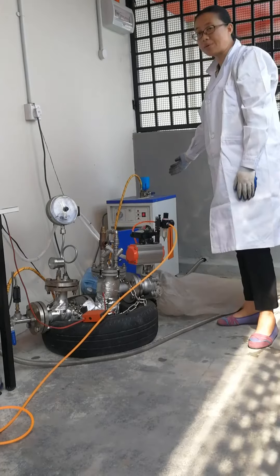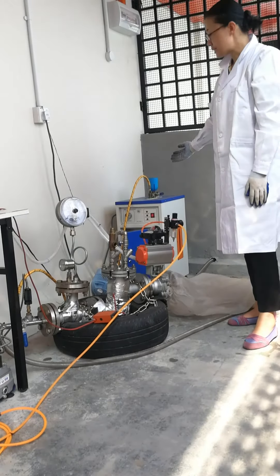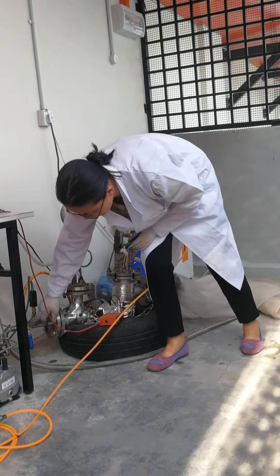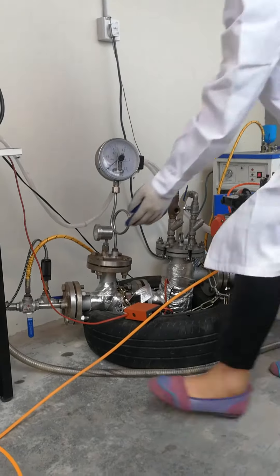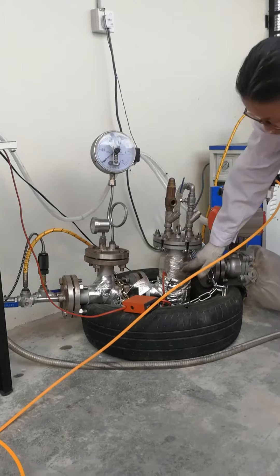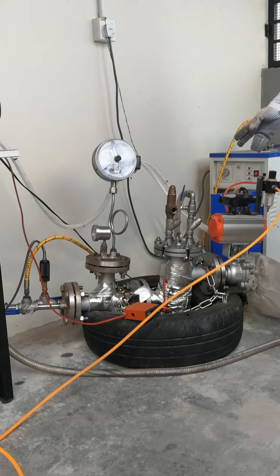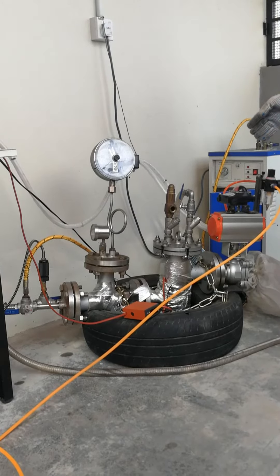We check and start the steam generator, then wait for it to stabilize. We open the charging valve and lead the gas valve outside. After the steam is ready, we let the steam into the reactor. The steam will pass from the bottom through the sample, then go out from the top. This pre-treatment lets the sample reach a proper humidity and also increases the temperature.